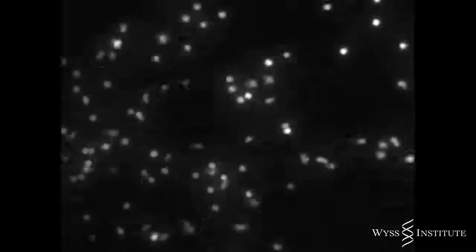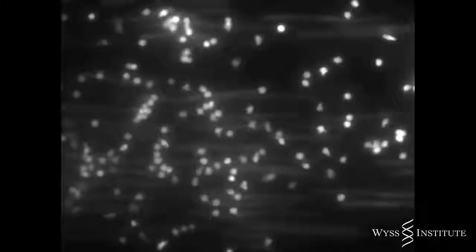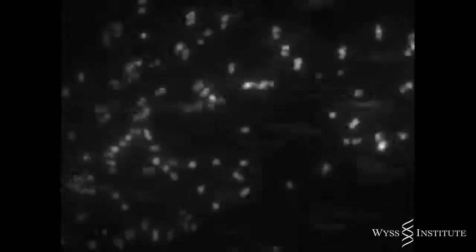Here's a video that shows this response in real time viewed through the device. The tissue cells are not visible here, but we can see white blood cells flowing freely in the capillary channel of the device, just as they do in blood vessels of a healthy person. But when we infect the air channel by adding bacteria, the immune cells abruptly stick to the surfaces of the capillary cells on the opposite side of the membrane, located directly below the infection site.